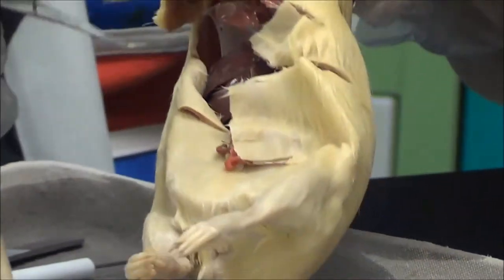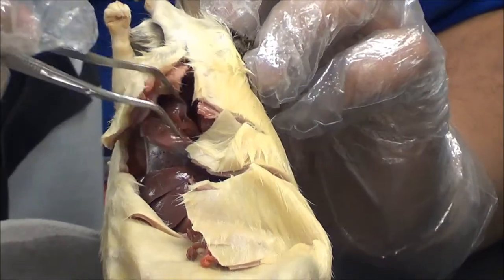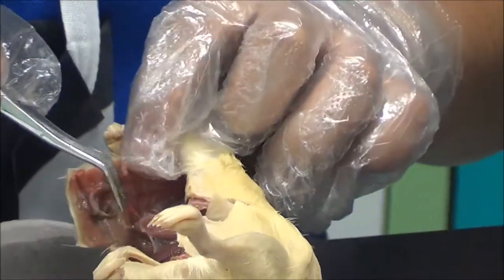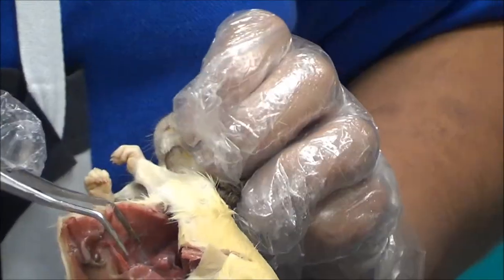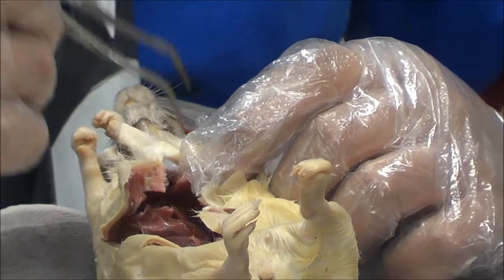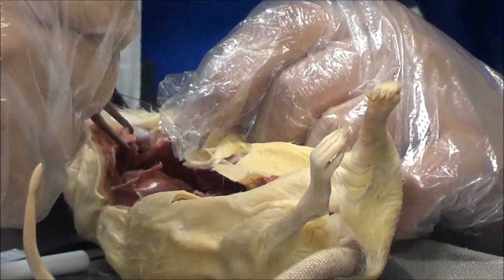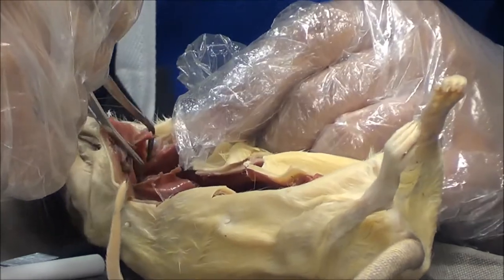This is the image of the rat on the inside. This is the liver. In here is the small intestines. And up here, this little sack right here, is the heart. Once the heart is exposed, you may grab the tweezers and cut whatever excess tissue is around the heart to expose it a little bit further.